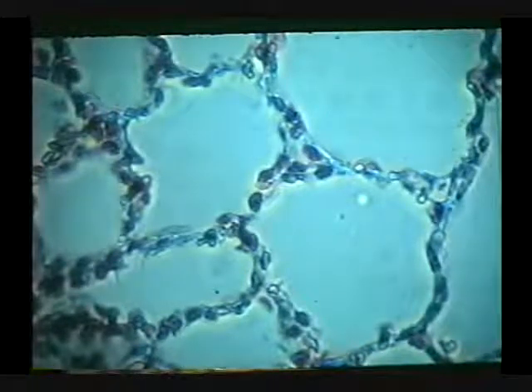This is fresh lung tissue — like two slides ago but unstained — viewed with a phase contrast microscope. The phase contrast microscope amplifies brightness by putting light waves of bright objects in phase with each other, and darkens dark areas by putting their light waves out of phase so they cancel each other out. Lightness becomes lighter and darkness becomes darker, which creates the luminous effect we see here.